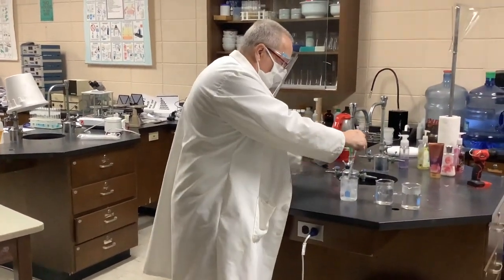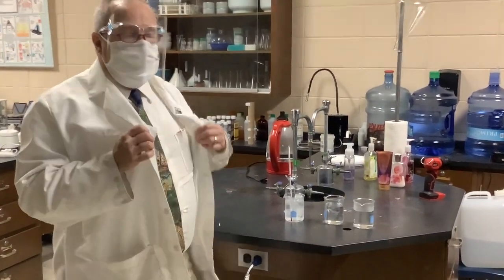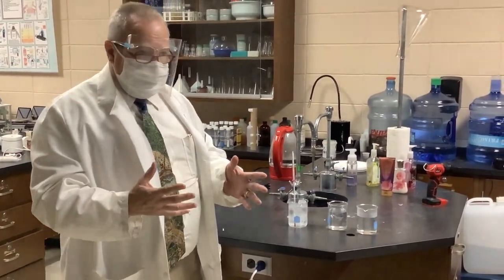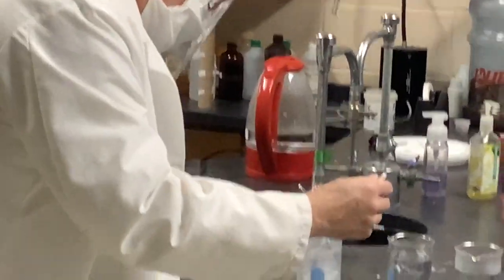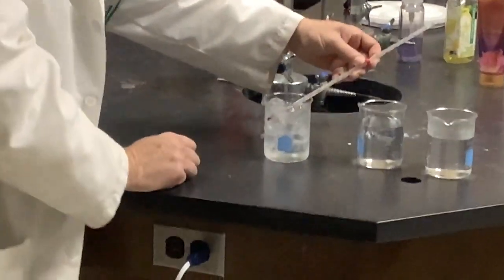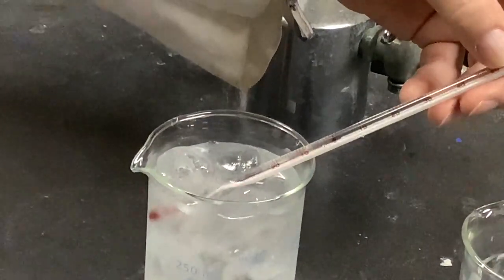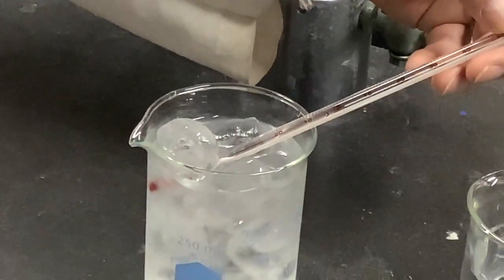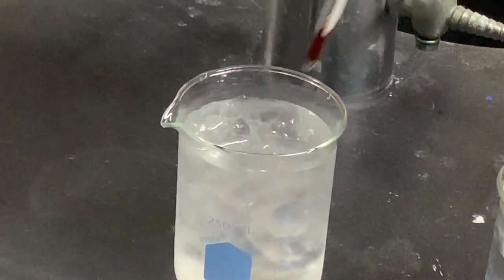So if I put it into the ice water, if you remember, most substances, water being an exception, tend to contract when chilled and expand when heated. And this is passing through a very thin capillary so that any changes are greatly magnified. So this particular thermometer has 2 different scales, but we want to use the Celsius scale. It is at 2 degrees C because I started with cold water and ice straight from the freezer at -20. So this beaker is at 2 degrees.